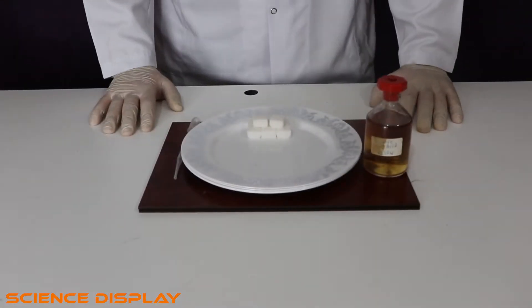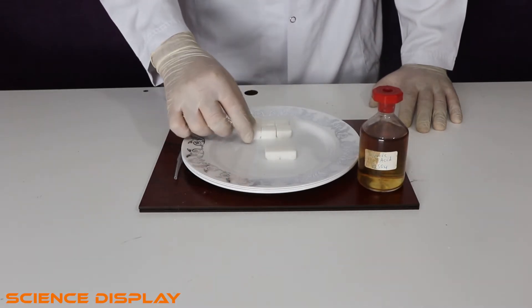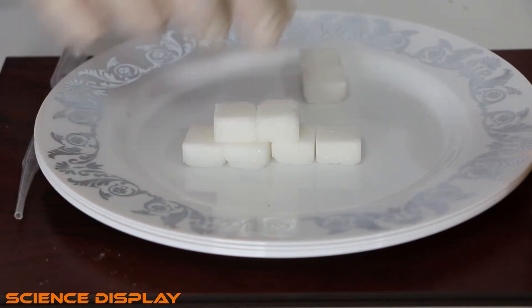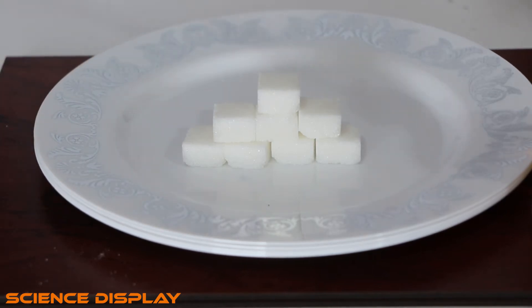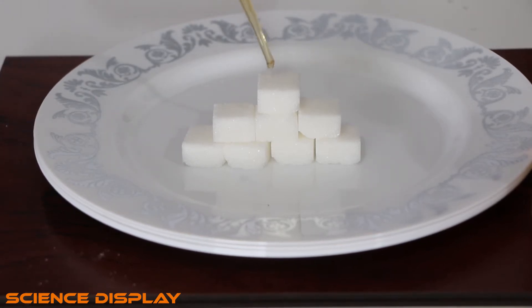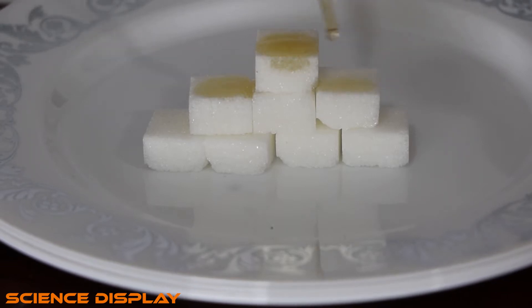Now I am going to check the reaction between sulfuric acid and sugar — cubic sugars, compressed sugars. Let's see the reaction between them. It will be really amazing, I think. Let's take the acid and pour it on the sugar slowly.